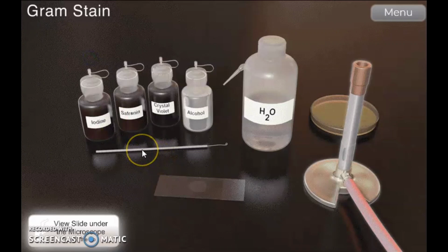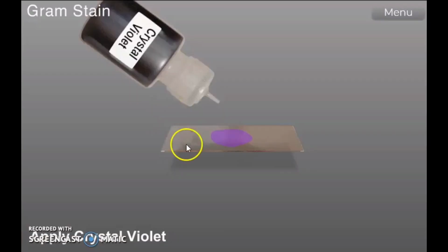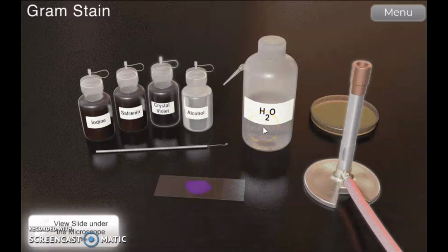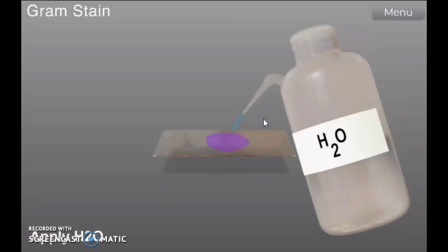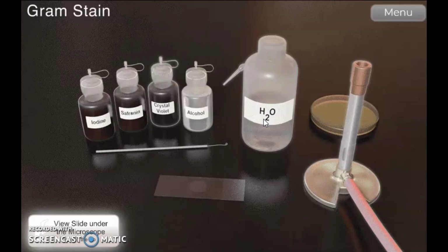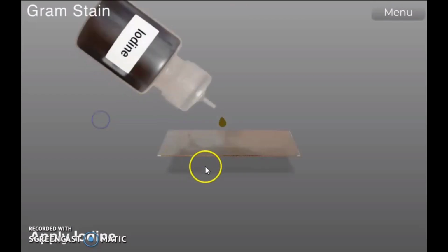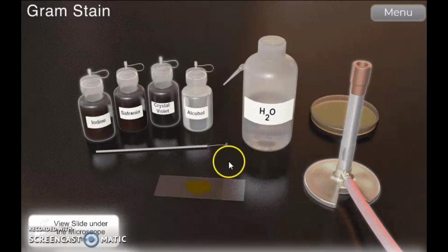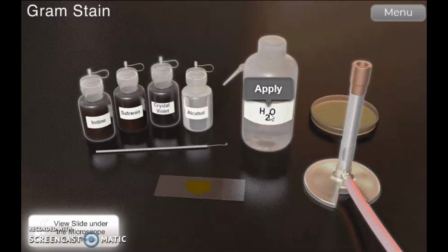Second, flood the slide with crystal violet for 1 minute. And then rinse with H2O. After that, flood the slide with iodine for 1 minute. And then rinse with H2O again.